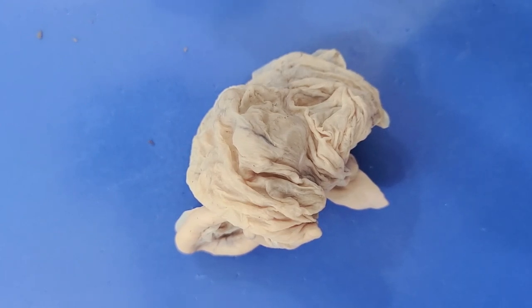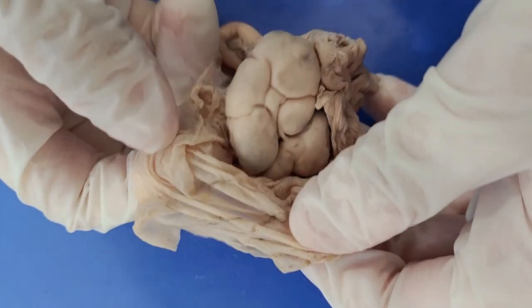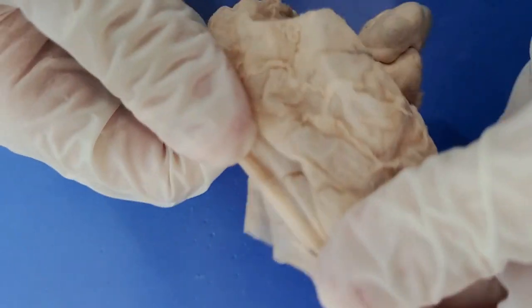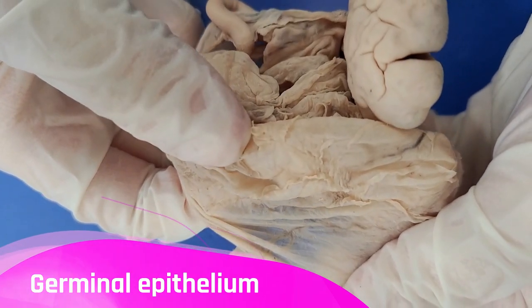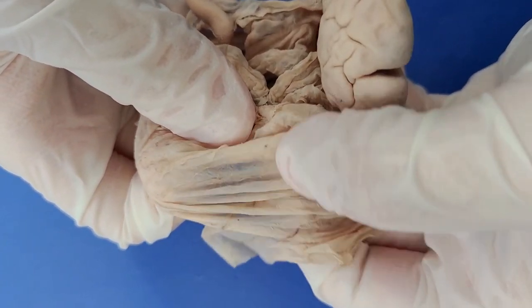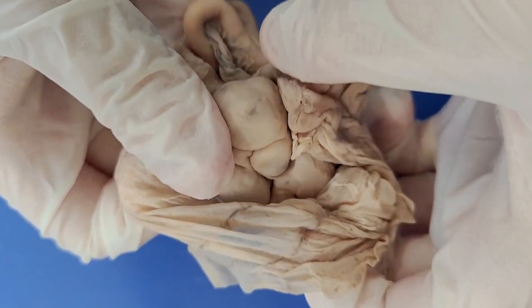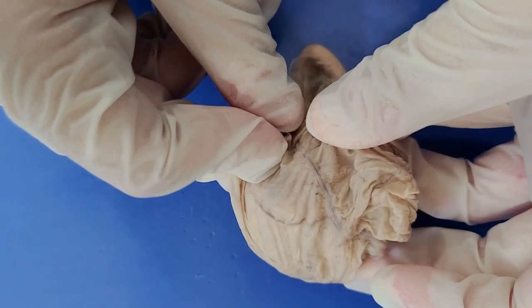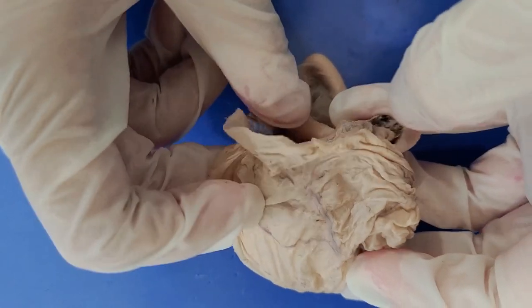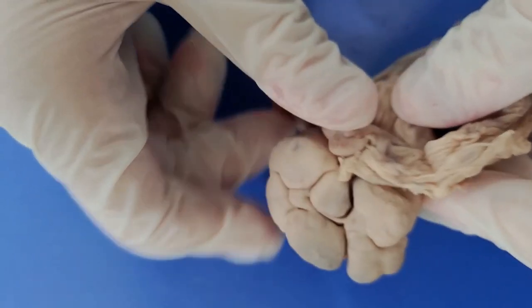The tissue covering the outside of the ovary — this thin membrane we can see here — is called the germinal epithelium. This is a thin membrane of epithelial cells that covers the ovary and protects it in this little sack. The main body of the ovary, this grape-like structure, is called the stroma.